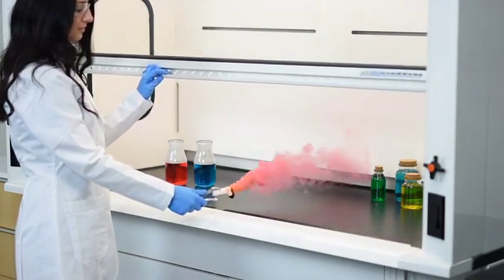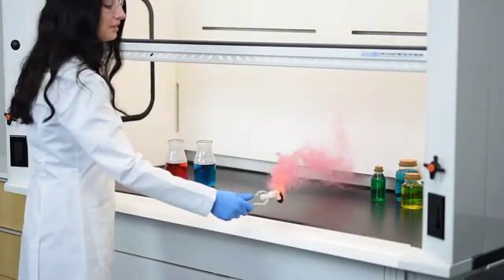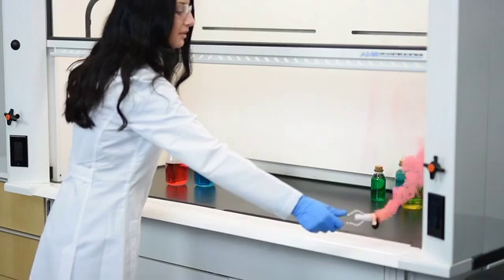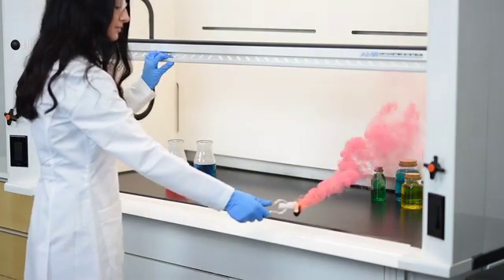As she raises the sash up, you'll notice the velocity starts to go down. AirMaster Systems makes a high performance hood, so as you can see, the hood is still functioning excellent, even with the sash at 18 inches.